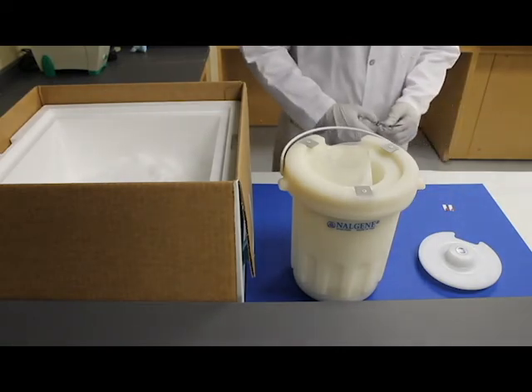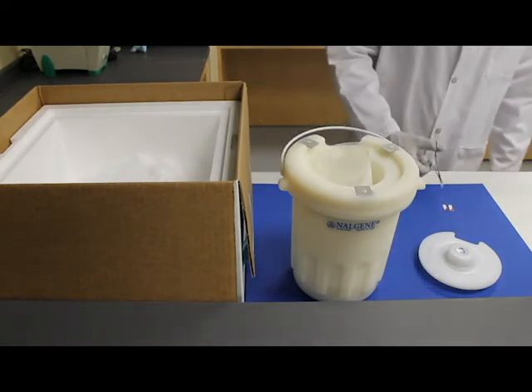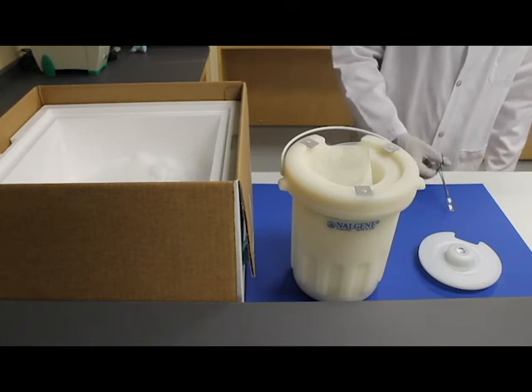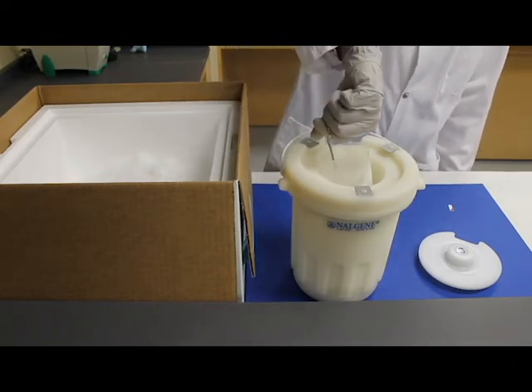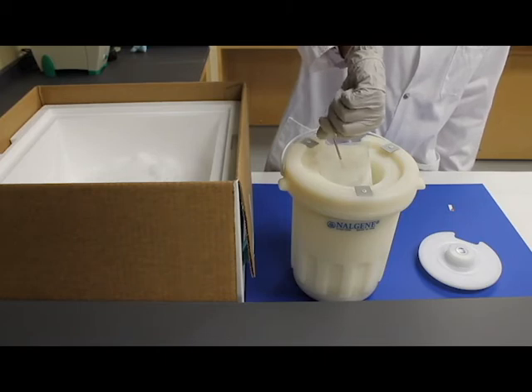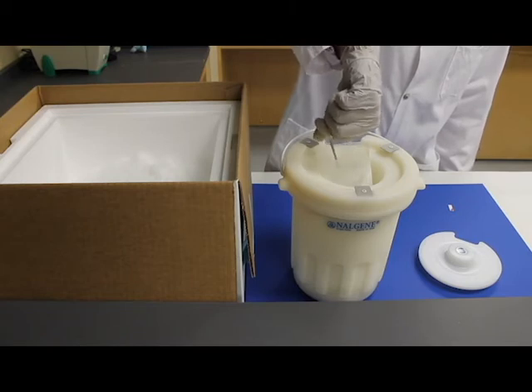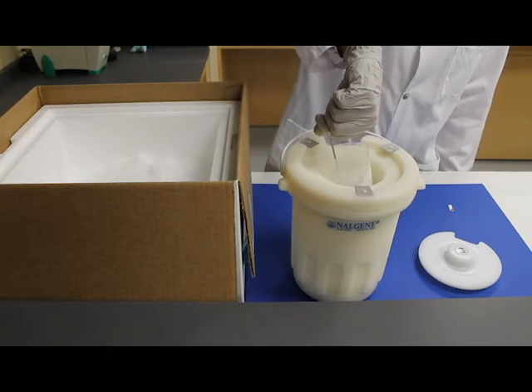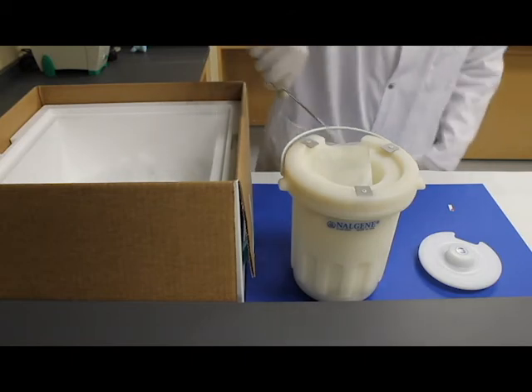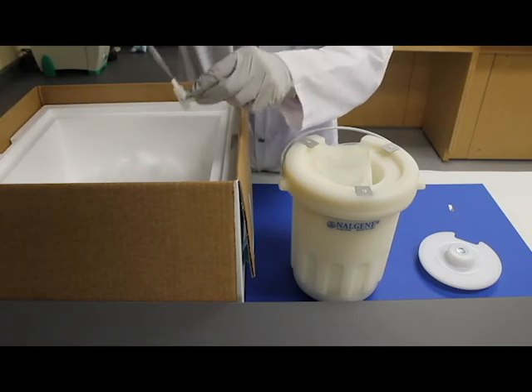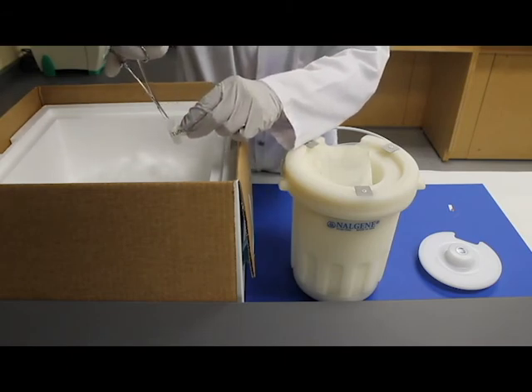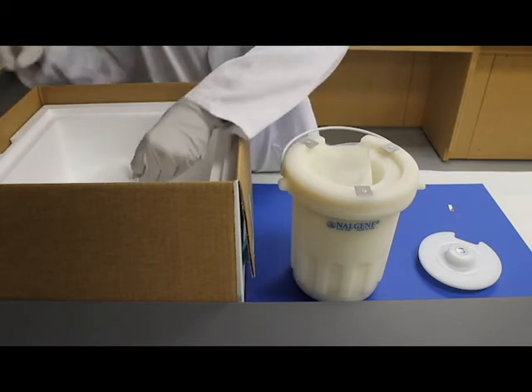Once both pieces of tissue have been mounted on the index cards, use a hemostat to carefully lock onto the opposite free end of the index card. Carefully take one of the index cards and muscle to the cooled liquid isopentane and lower the muscle into the isopentane. Swirl the samples in the isopentane for 15 seconds. Retrieve one of the pre-chilled 2ml cryotubes from the dry ice, open and place the index card and the sample into the tube by releasing the hemostat. Quickly, replace the screw cap and put the 2ml cryotube back on dry ice.